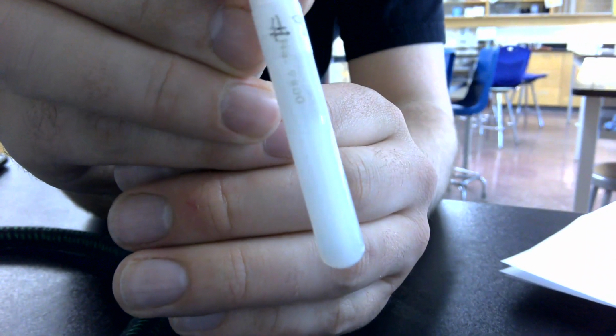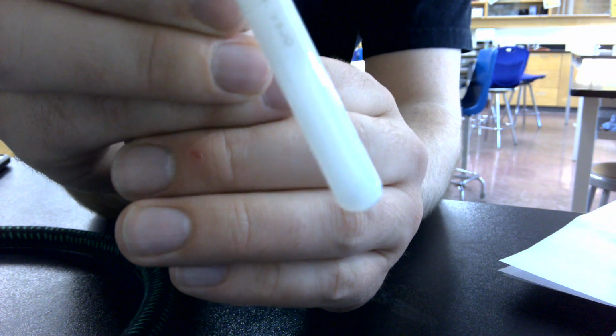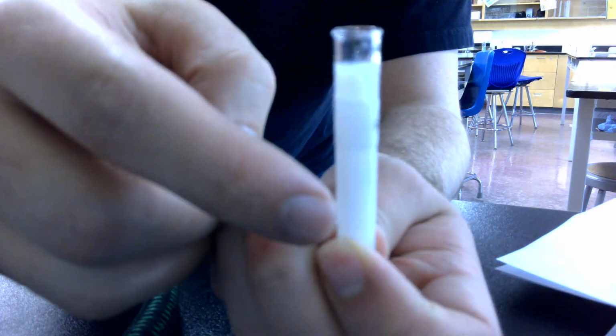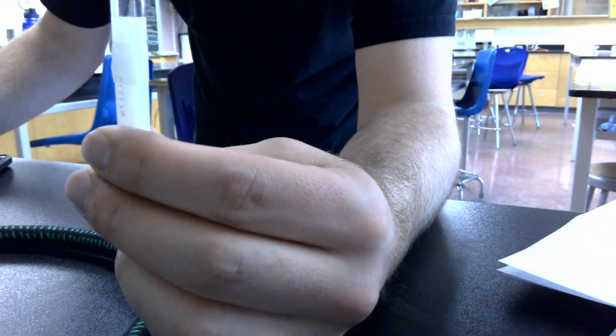I don't know if there's any other color in there. I'm colorblind, makes this really difficult. But it might have just a slight yellowish tone to it, kind of a gross color. But for the most part, it looks a bit like milk. It's pretty thin like water. That is that reaction. Okay, I'm going to pause the video and we'll check out the other one in about 5 minutes.